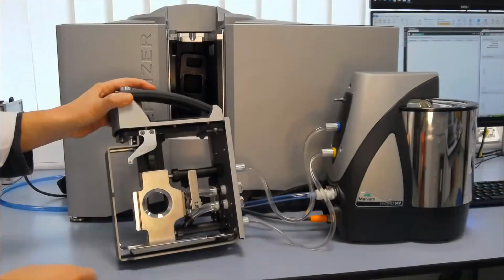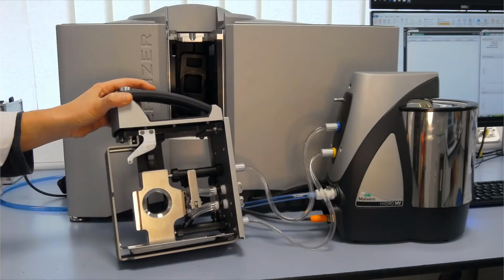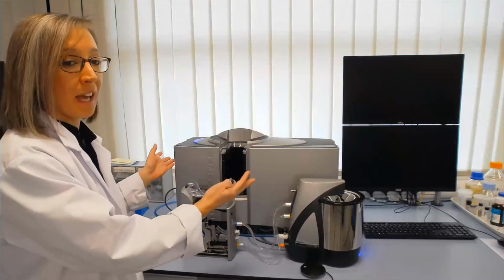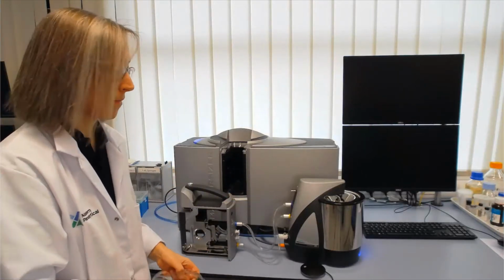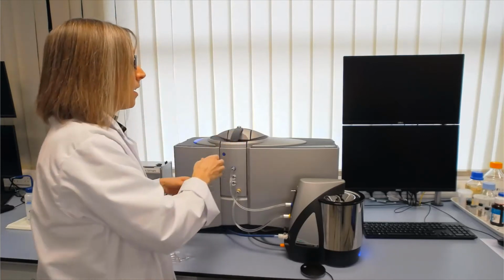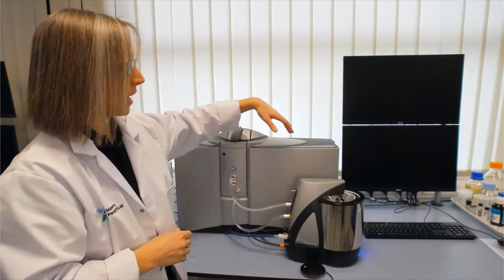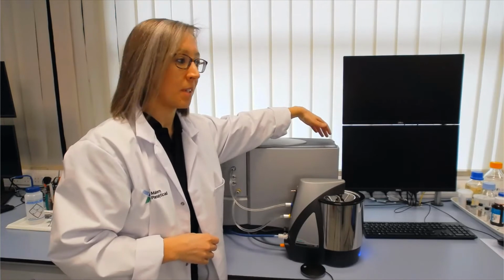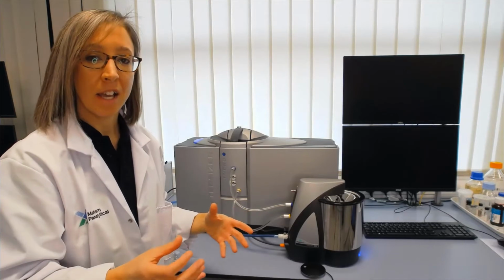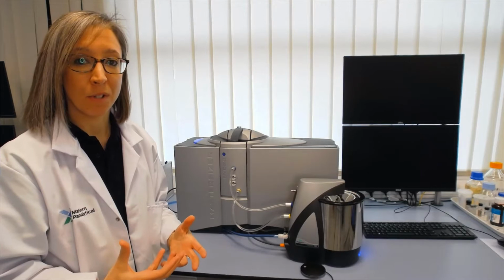What you can see in the measurement cell is the window here. The particles will be flowing through the measurement cell. They'll interact through the window with the laser light, and then the particles will scatter light over a range of different angles. So if I pop that back in, you can imagine our particles are then scattering light over a range of different angles. We have detectors along the back of the instrument, along the sides, and some backscatter detectors in order to collect that light scattering over a range of different angles, giving us a wide-ranging particle size measurement.